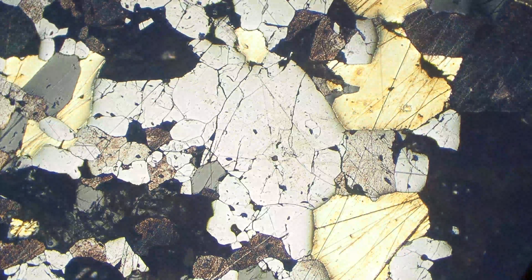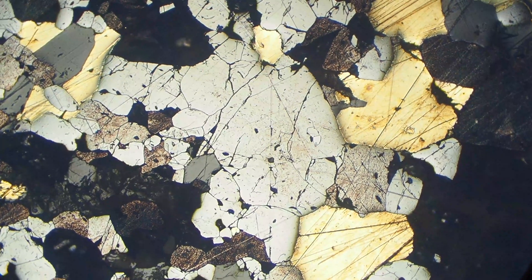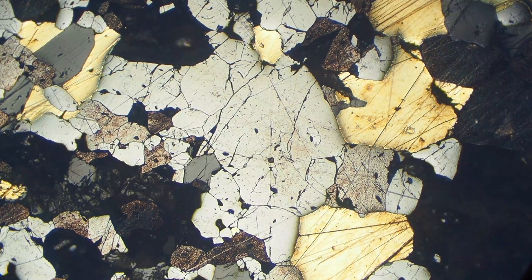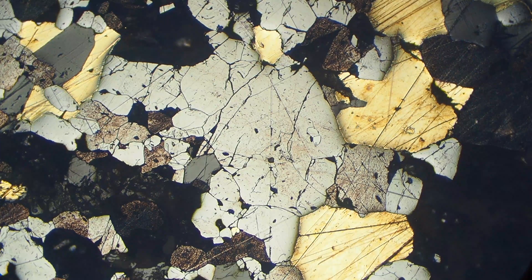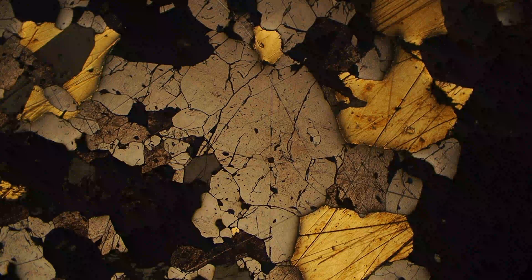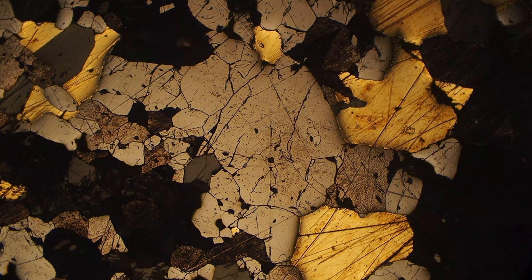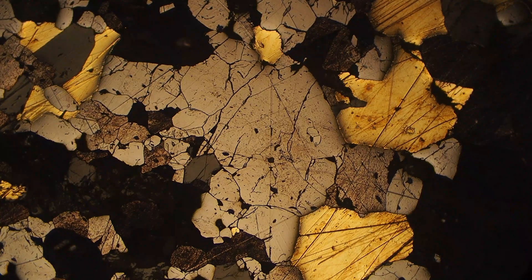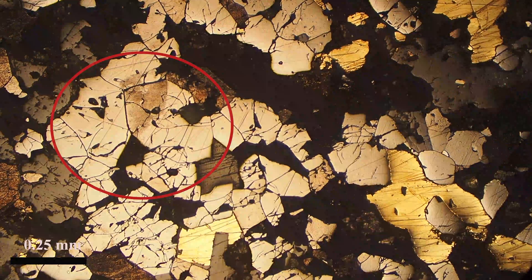One thing with samples like these, where we have quite a bit of magnetite, is that you can also put a magnet on the polished mount itself and it should track the magnet.